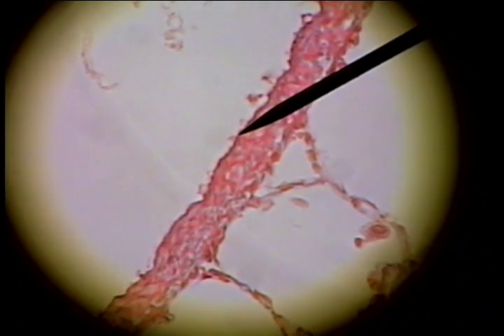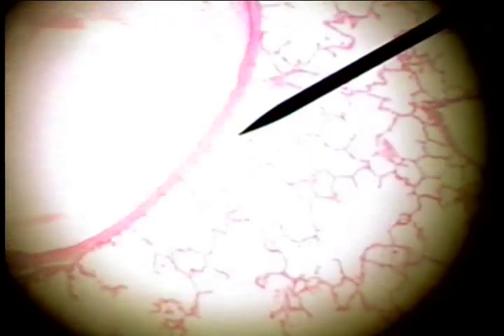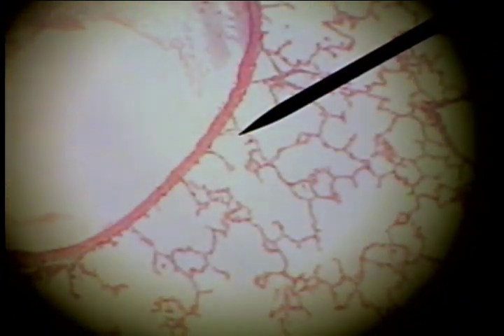so this is a blood vessel found in the interior of the lung tissue.